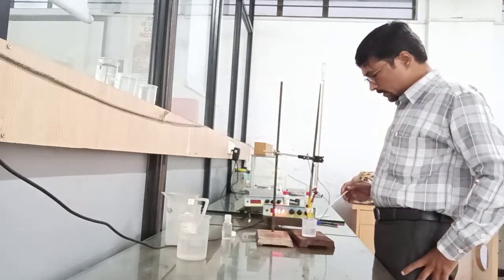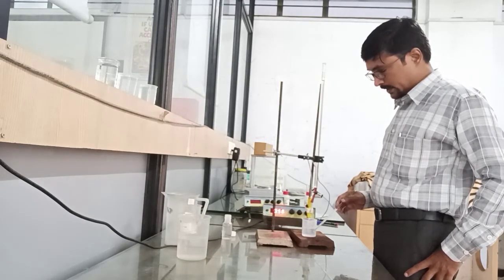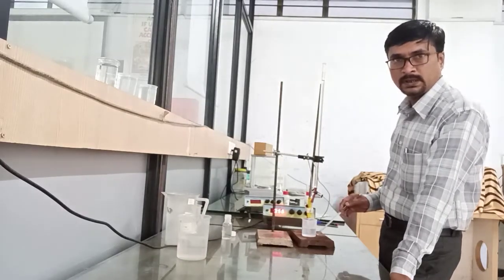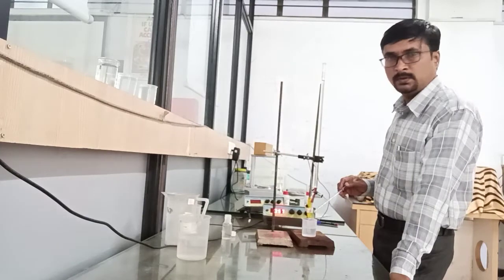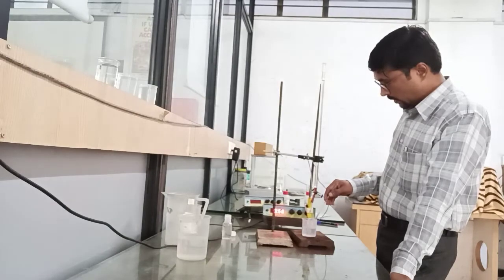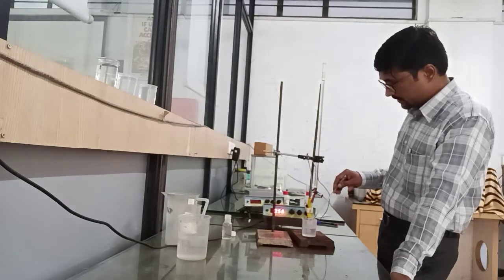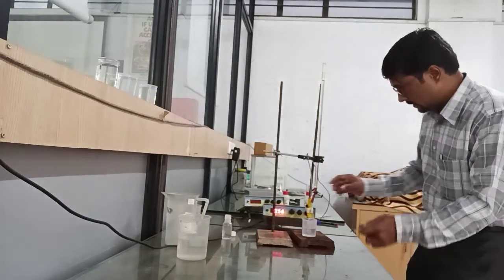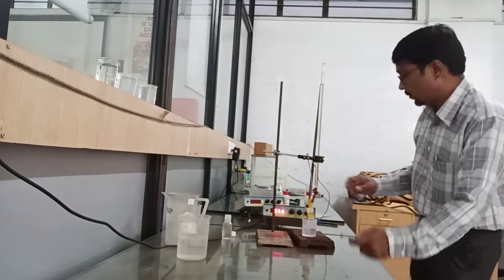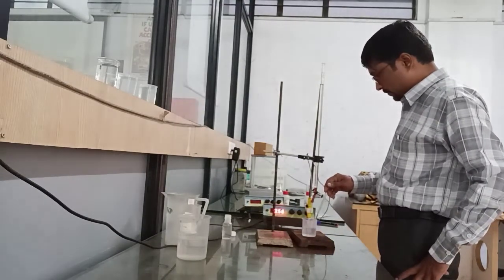In this second part, I have prepared a solution of HNO3 by addition of 2 ml of concentrated HNO3 and 50 ml of distilled water. At 0 ml addition of 1 normal NaOH, the pH value is 0.56. After addition of 1 ml of 1 normal NaOH, the pH value is 0.56.